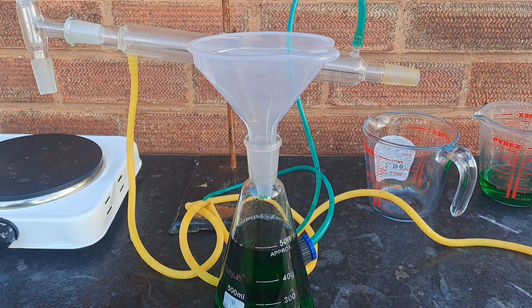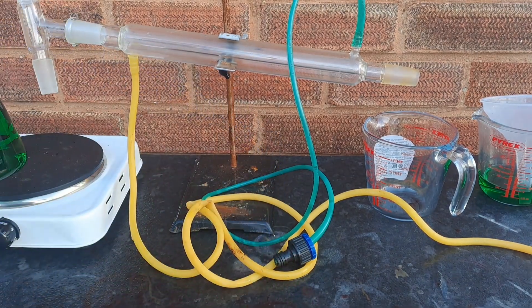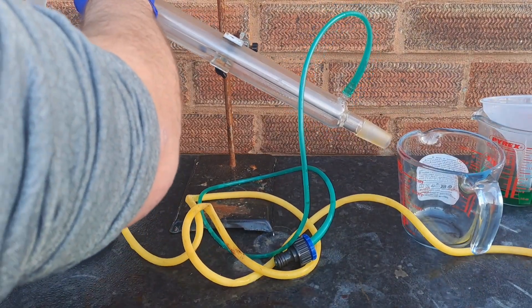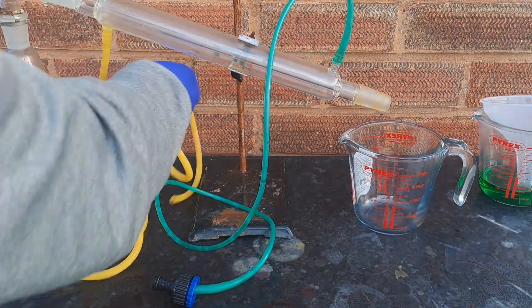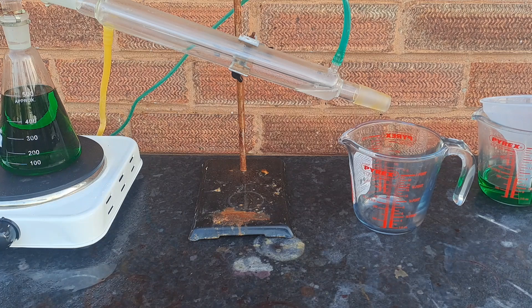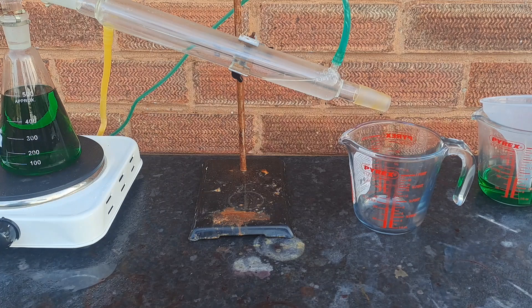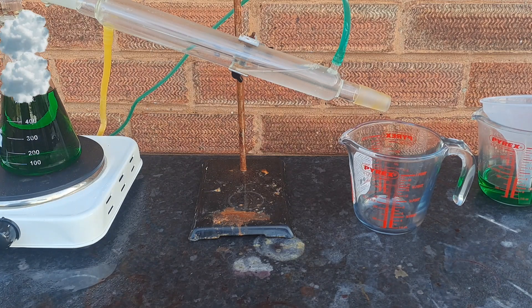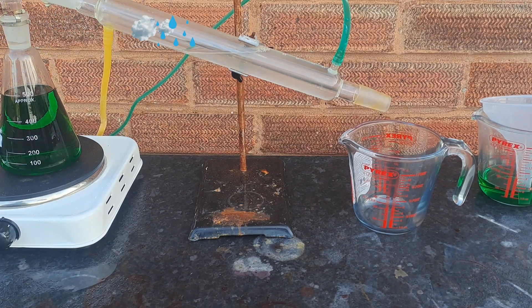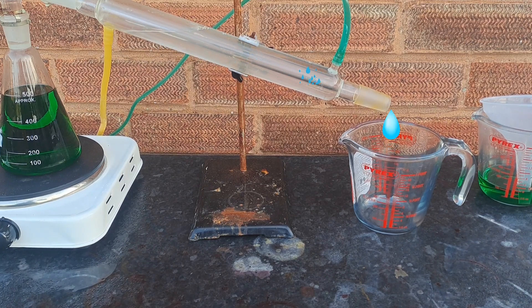You must start with a solution where HCl is present in a free, volatile form. Without that, the chloride remains chemically bound to the copper, and most of what is distilled would be water. My solution is diluted — probably to twice its original volume due to multiple rinses — so the acid in theory should already be around 20%, but due to the chloride ions being bound to the copper ions, the acid recovered will be significantly lower. What is going to happen during the distillation is the liquid will boil, vaporize into a gas, and travel up to the condenser, where it will condense back into a liquid, and travel to the receiving jug as a clear dilute acid, leaving behind copper(II) chloride salt in the boiling flask.